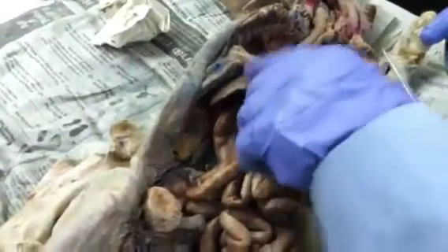That's really what you need to know. The gallbladder is located on the right medial lobe of the liver. These are lungs, that's liver.